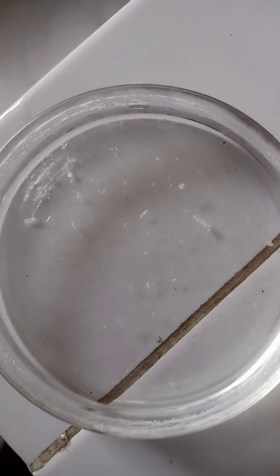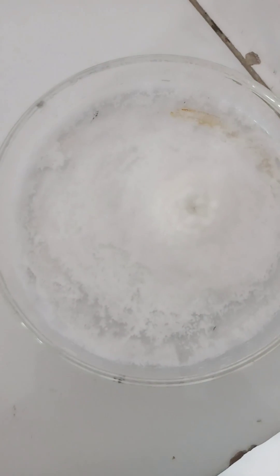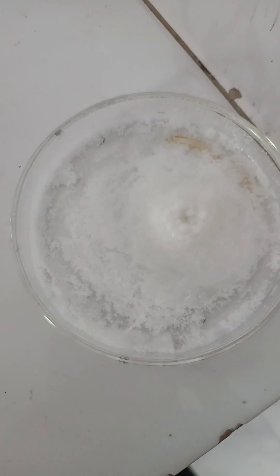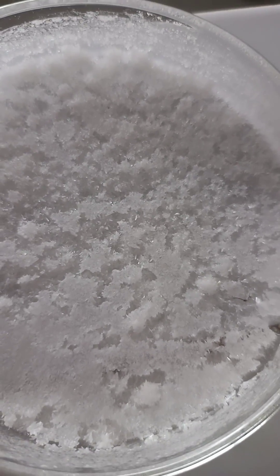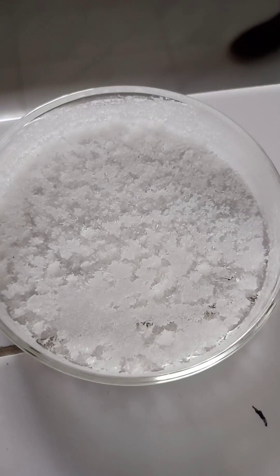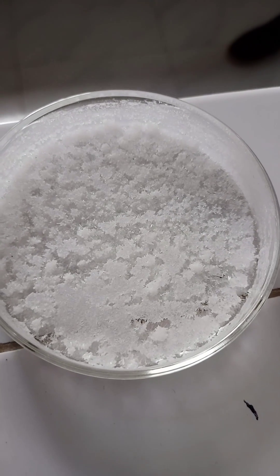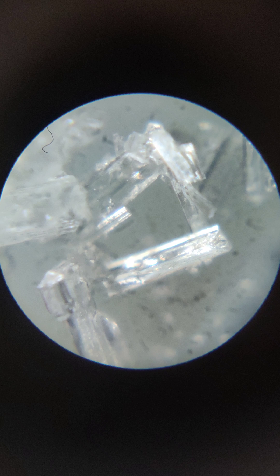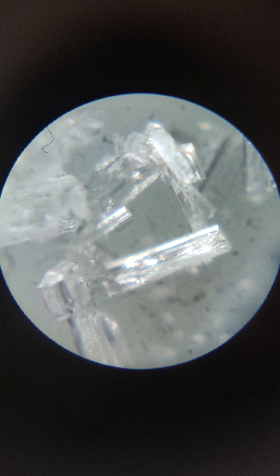After 5 to 10 minutes, the recrystallized Phenyl Benzoate is visible — this is the final product. Lastly, the Phenyl Benzoate is kept under the microscope and it looks like crystals.